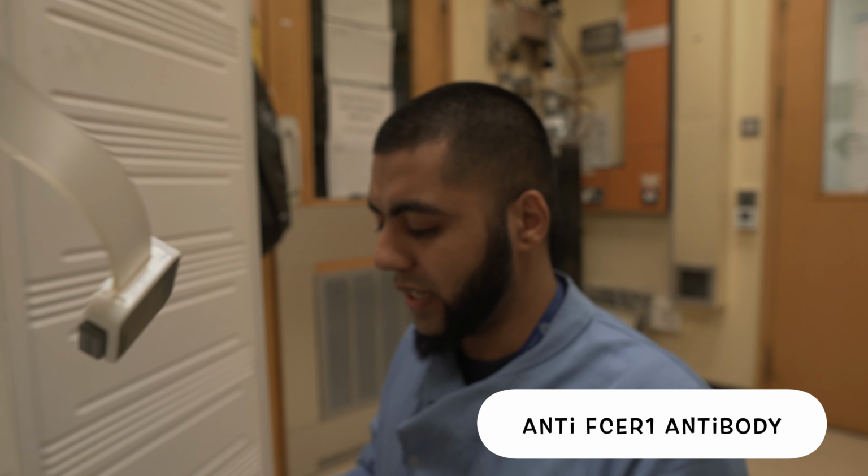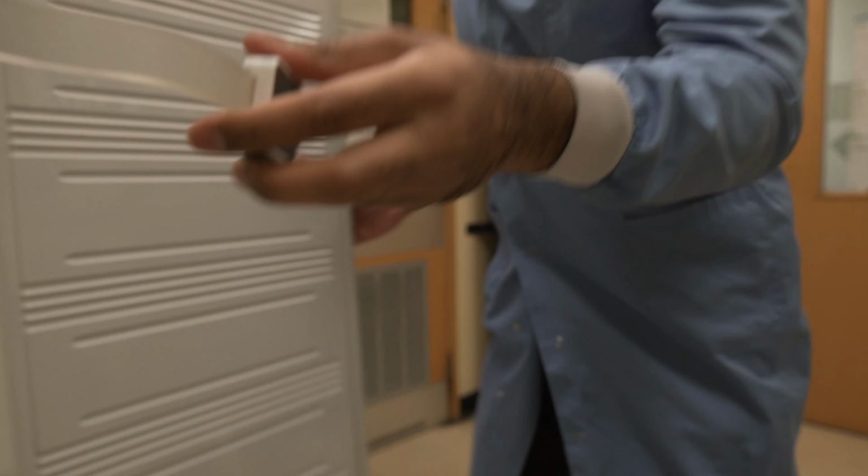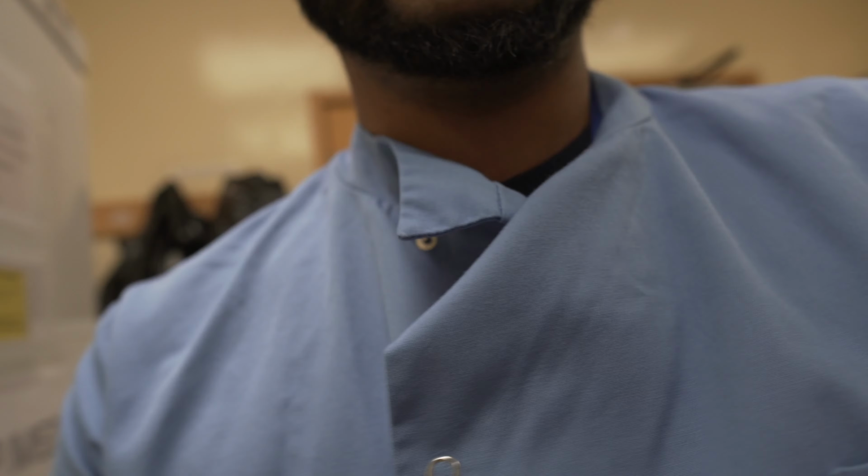But I leave one of the special ones to last, which is this one over here. This is what we know as anti-Fc epsilon R1 antibody. Now, before my shins break because I'm kneeling down, bear with me one second. So, anti-Fc epsilon R1 antibody is used to directly trigger mast cell activation.